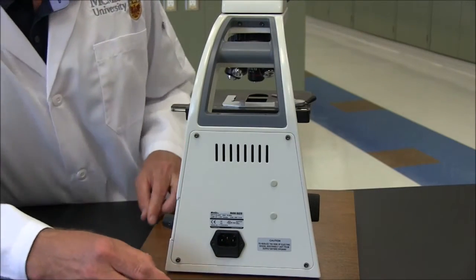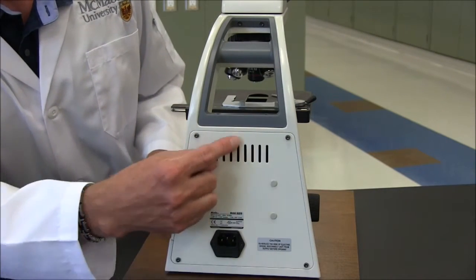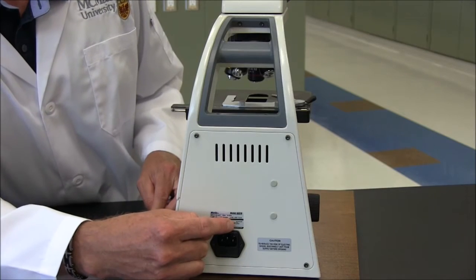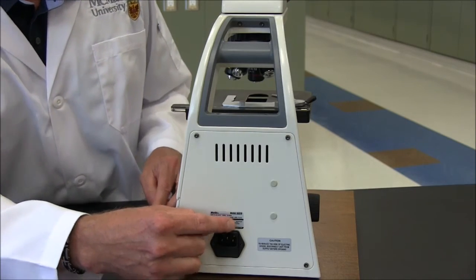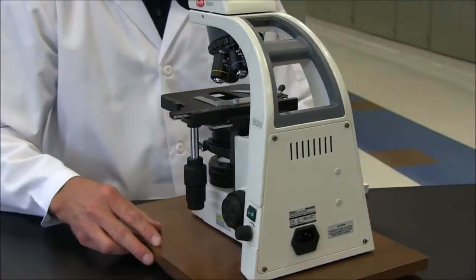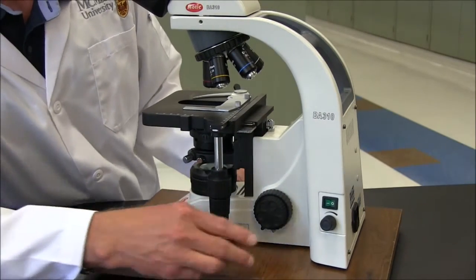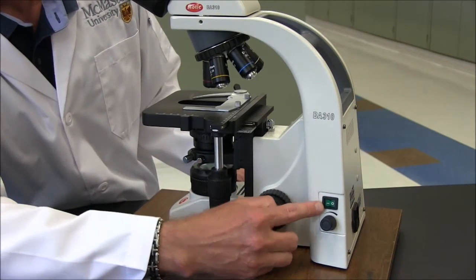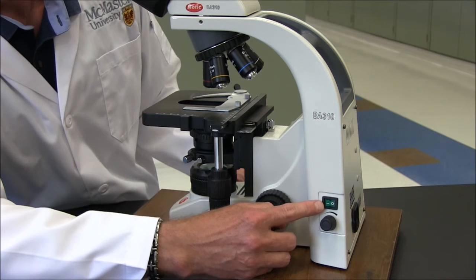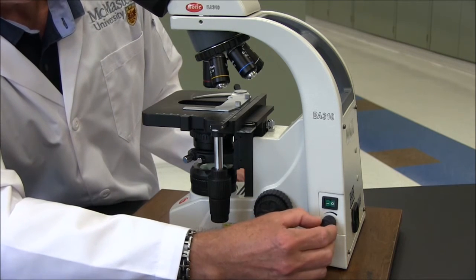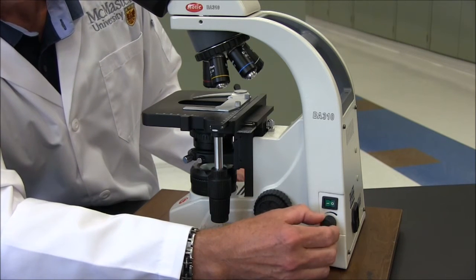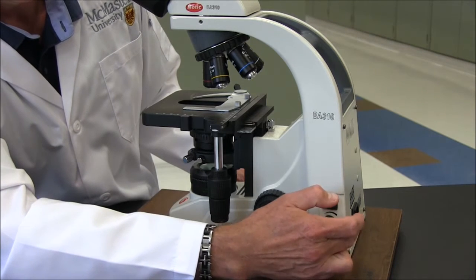At the back of the microscope is the main plug-in, and within this housing, the halogen lamp is located. On the right side of the microscope is the main power switch, which turns the microscope on and off. There's also the brightness control knob, which controls the brightness of the halogen lamp located in the housing here.